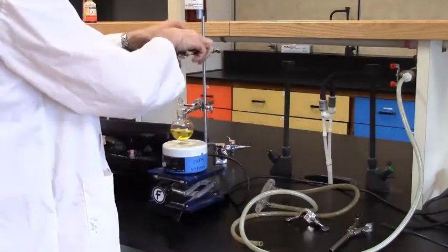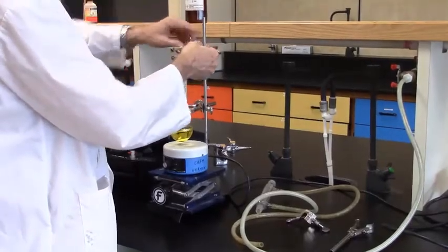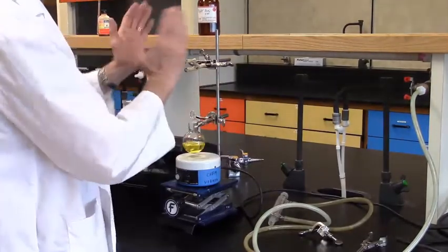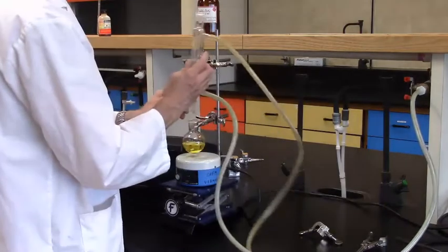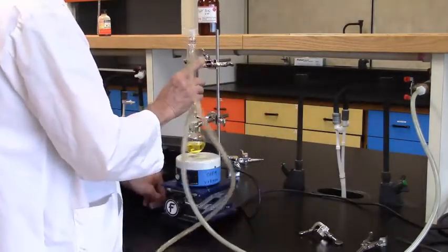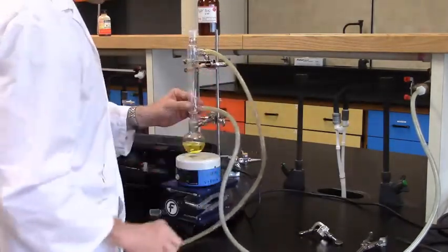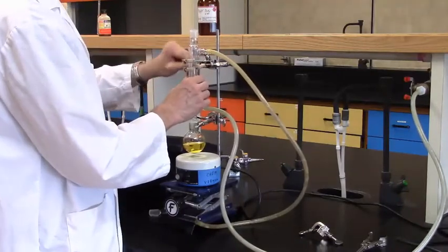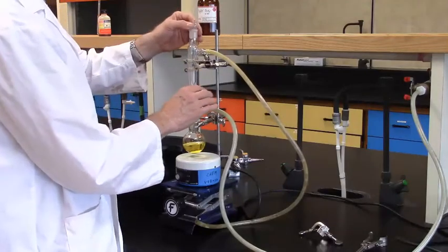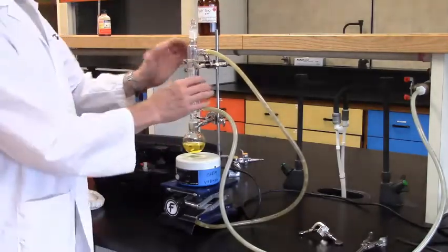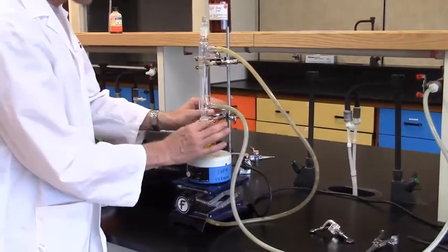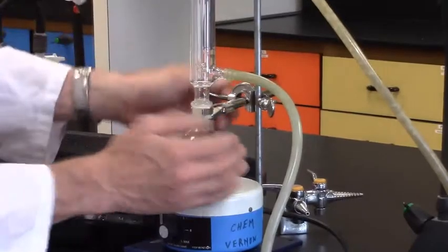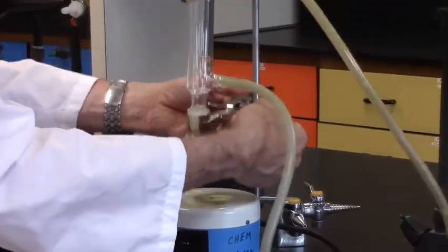So, I'm just going to put it here, and again, it's a support. It's not tight. We don't need too many contact points here. It's just going to stop that whole apparatus from moving left to right. So, fixing in, and adjusting, and again, I stopped the whole system. Now, this system is secure. It is tight here. This is holding the reaction vessel or the reaction pot, and this clamp is actually loose, and I can illustrate that quite nicely as it moves freely.